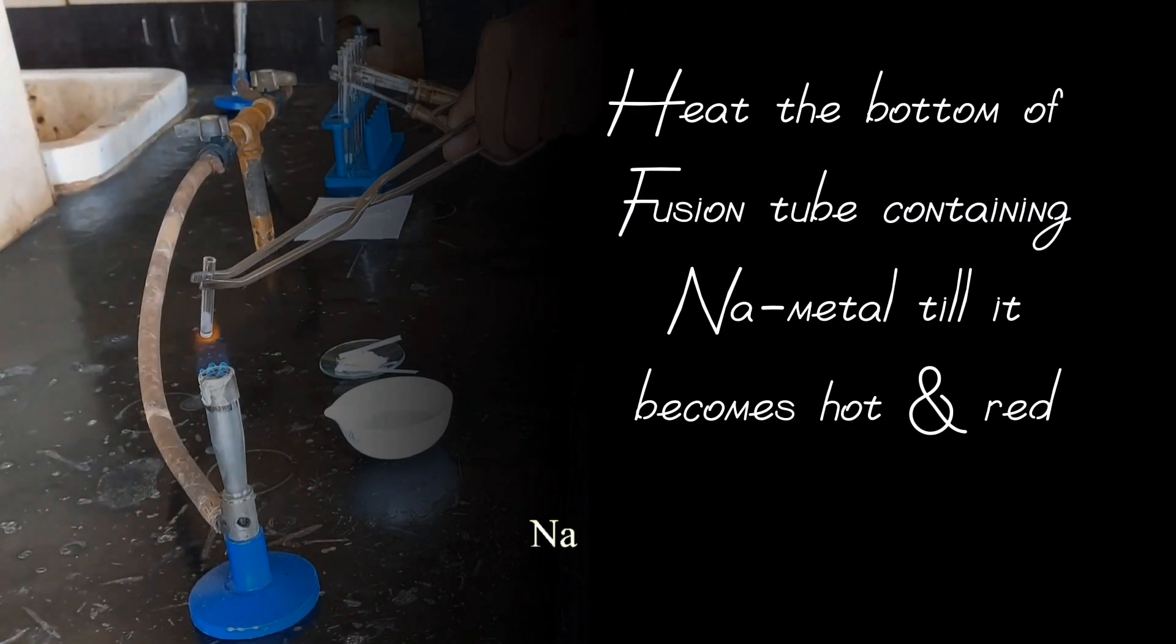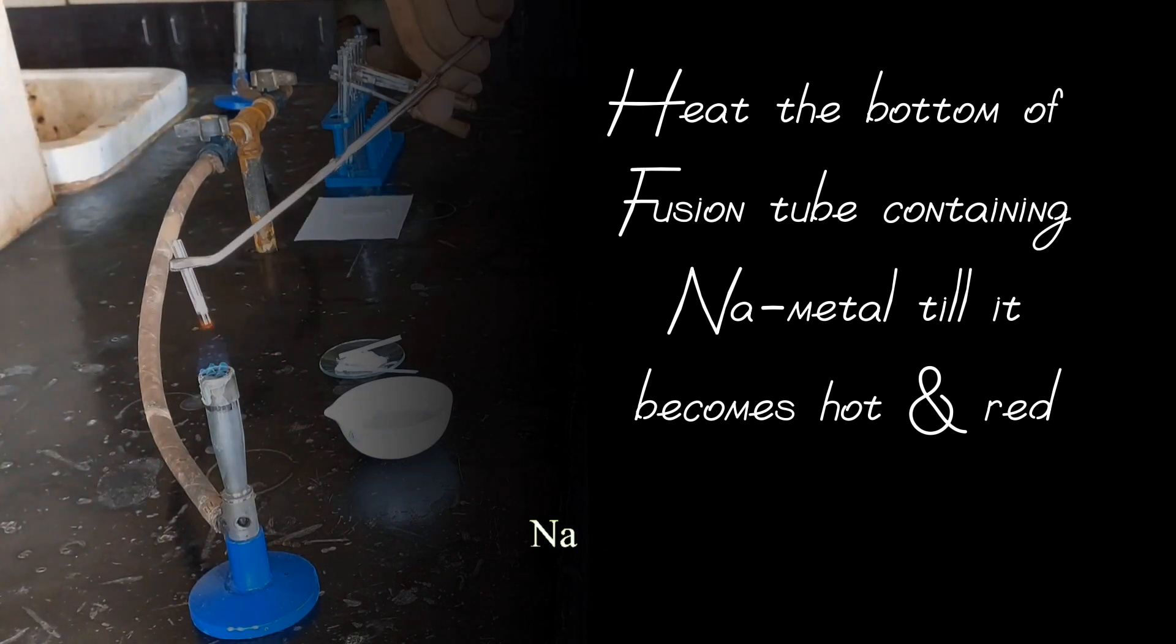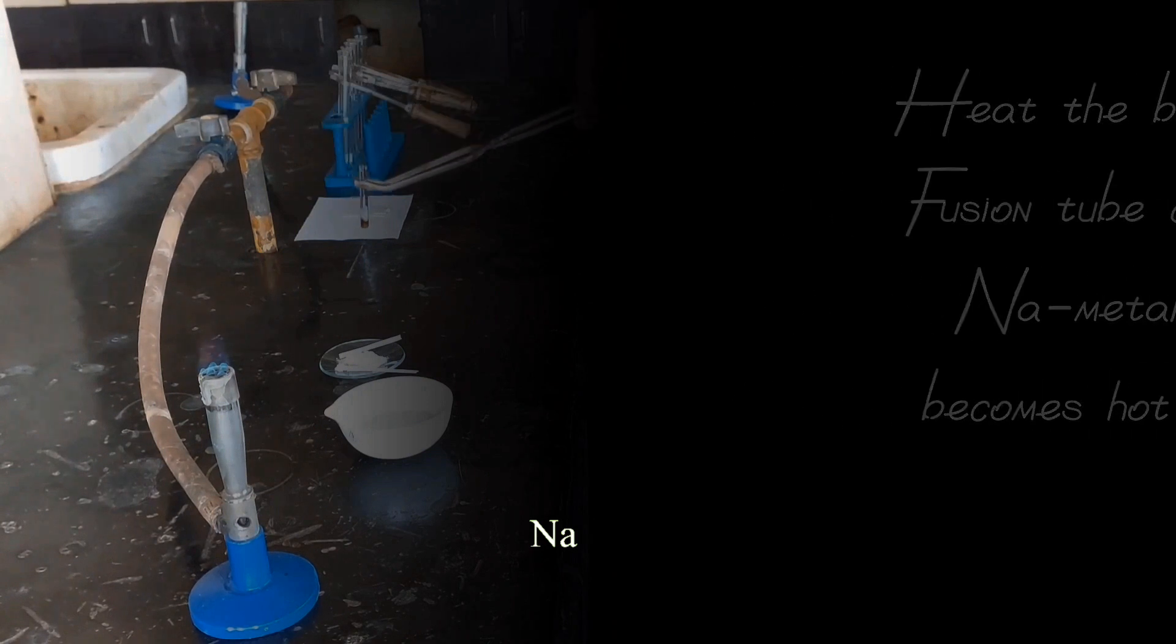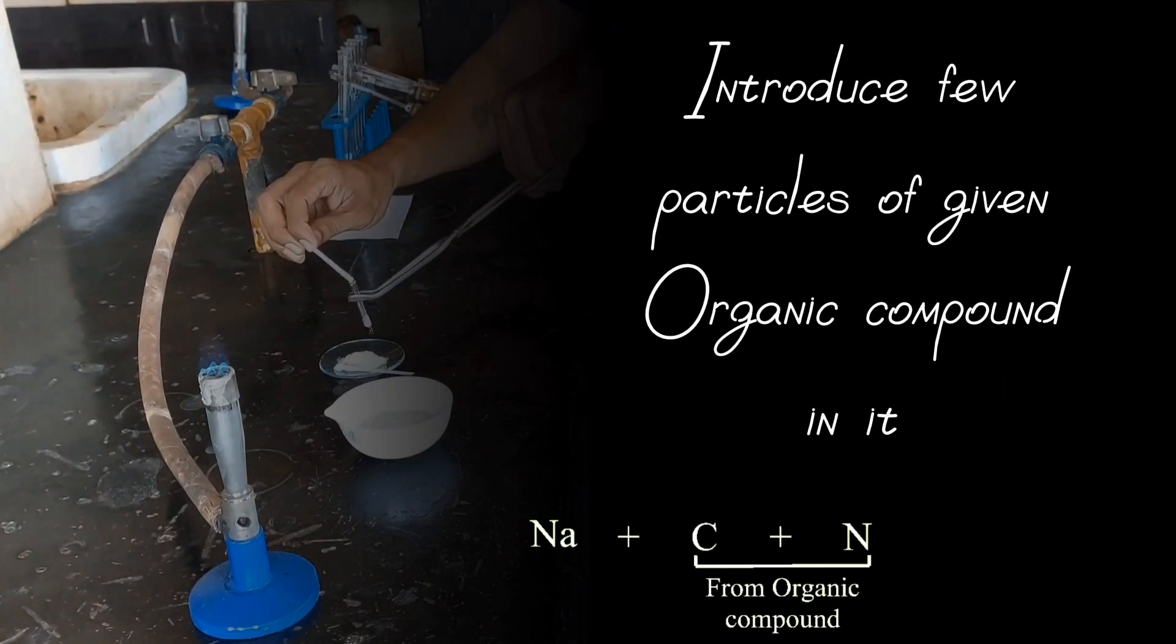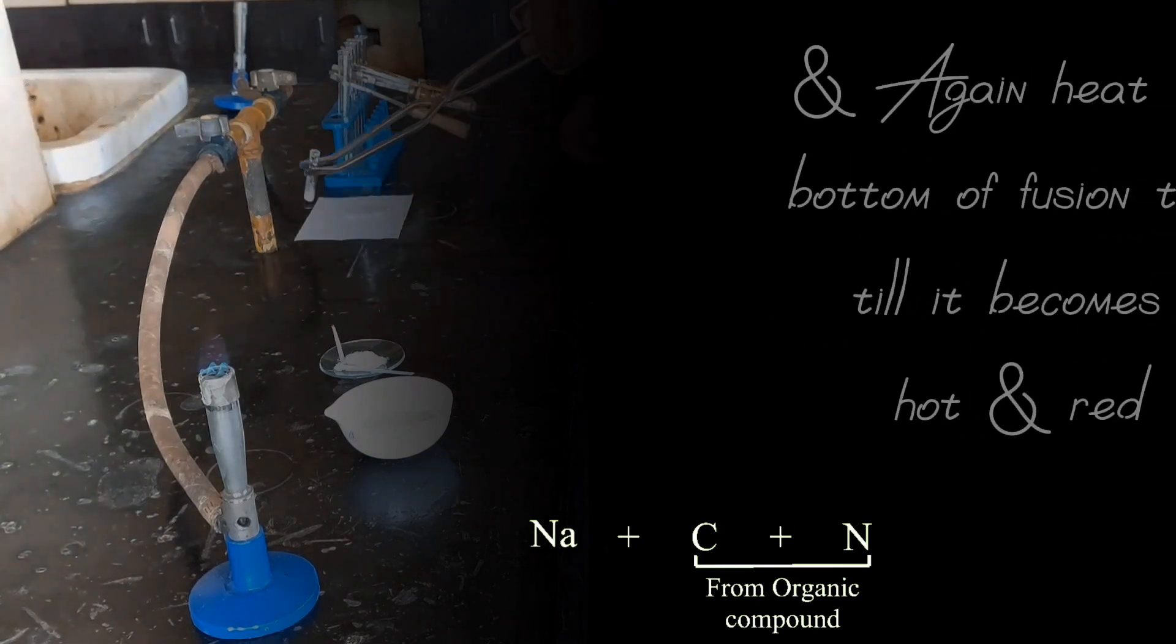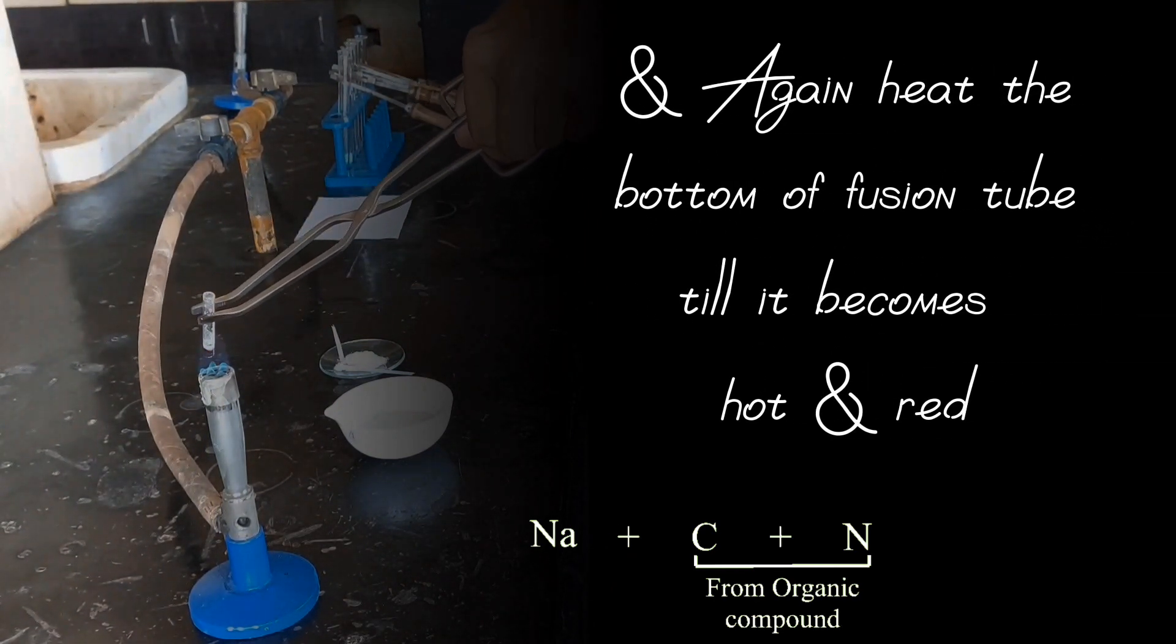Heat the bottom of fusion tube containing sodium metal till it becomes hot and red. Introduce few particles of given organic compound in it and again heat the bottom of fusion tube till it becomes hot and red.